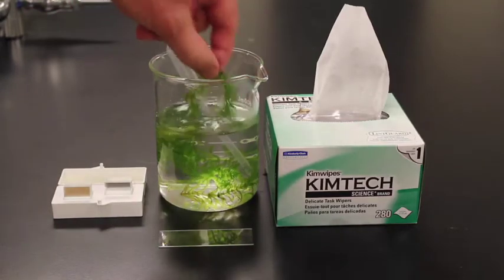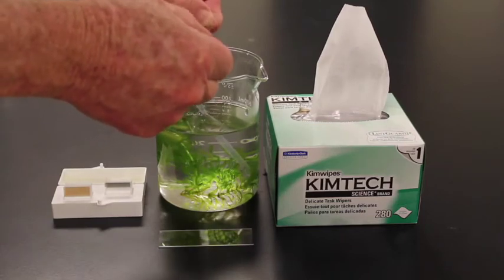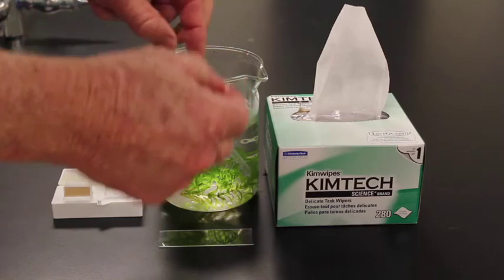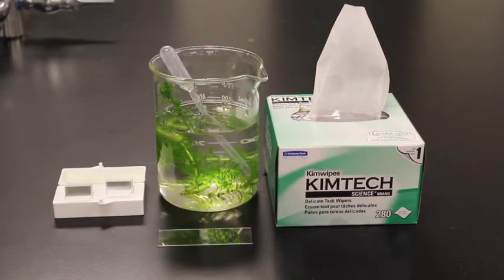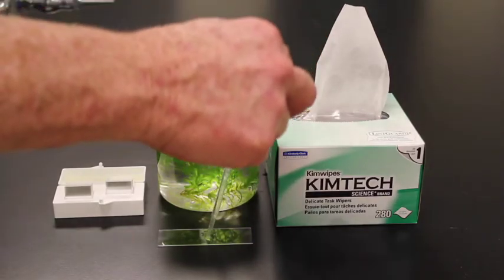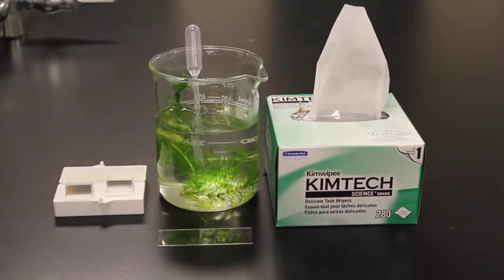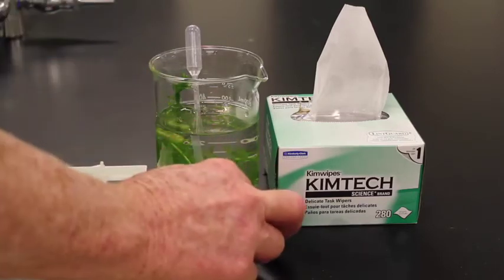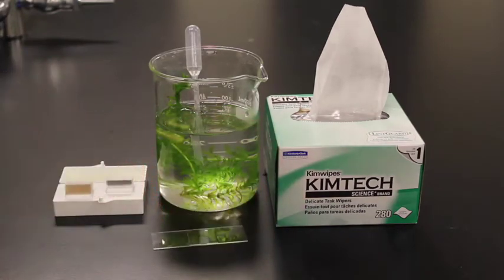Then I'm going to reach in here. We want a teeny tiny leaf off the top. So you get a little leaf right off the very, very top of that. And I just want one leaf. We'll put it down and stick it down on there. And now I'm going to take my eyedropper, get a drop of water, put that right on top there. Now I'm going to grab a cover slip and gently put the cover slip, whoop, we just want one cover slip, not two. Gently put the cover slip down on top. And here is our wet mount all ready to go.